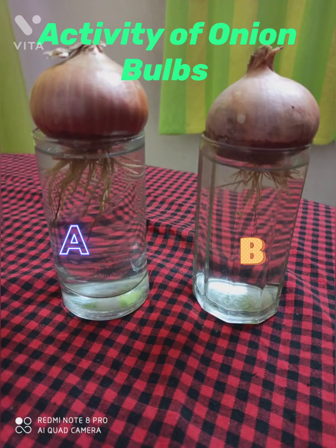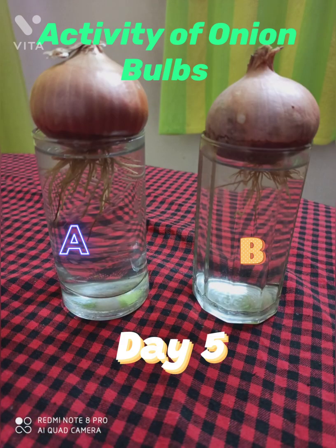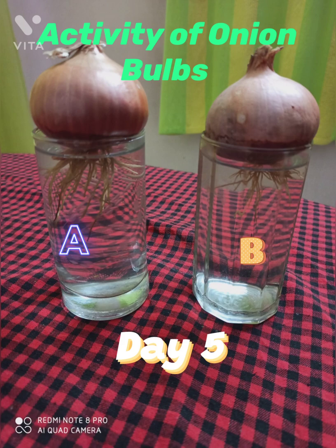This is the observation for day 5. As you can see, the roots have almost covered half of the beaker and they are growing rapidly.